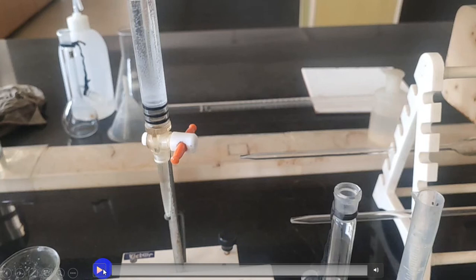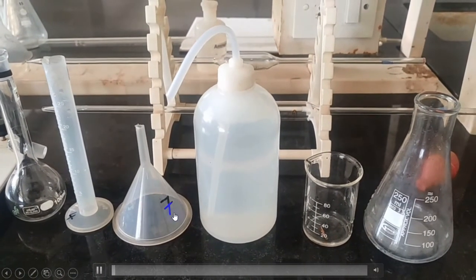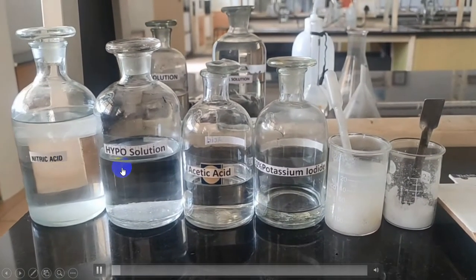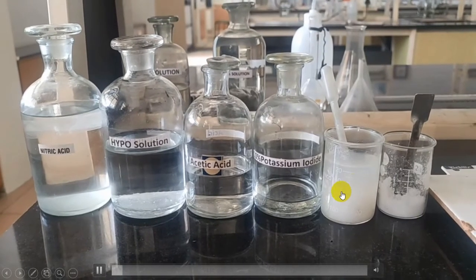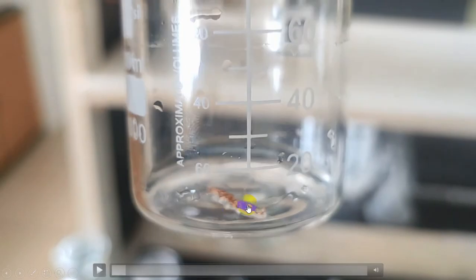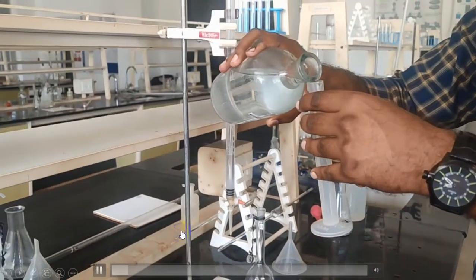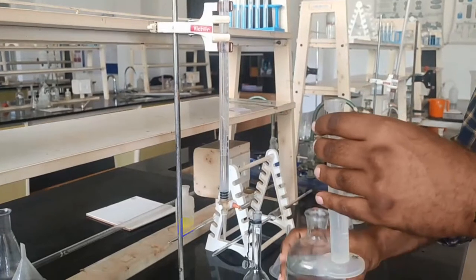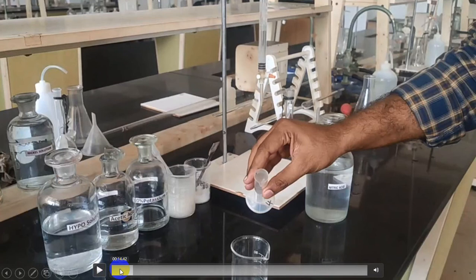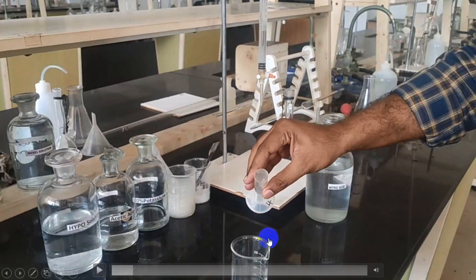Let us see the experimental demonstration. The instruments required are: burette, standard flask, measuring jar, funnel, wash bottle, beaker, and a conical flask. The chemicals required are nitric acid, hypo solution, acetic acid, potassium iodide, freshly prepared starch indicator, and urea. Weigh a known weight of brass sample, note that weight, into a beaker. Add 1:1 nitric acid to prepare brass solution. Part A is the preparation of brass solution — weigh a known weight of brass sample and add 1:1 nitric acid.